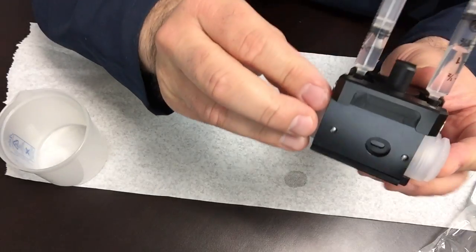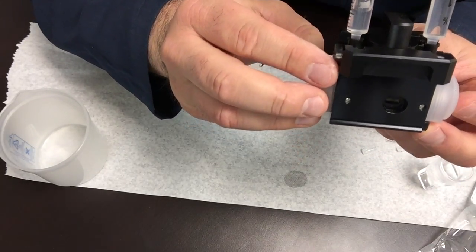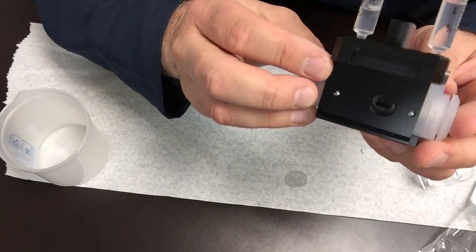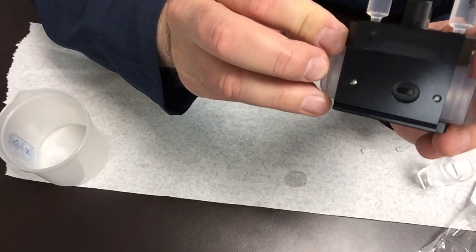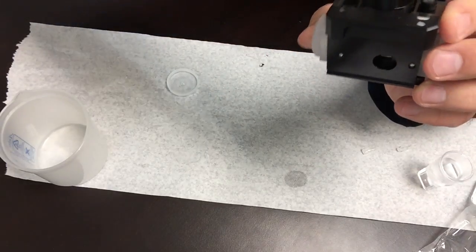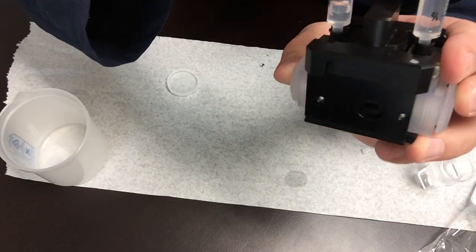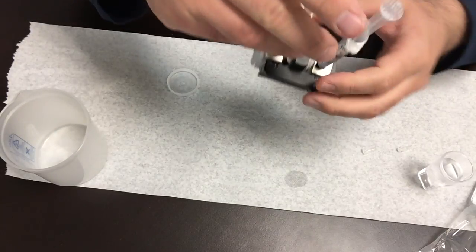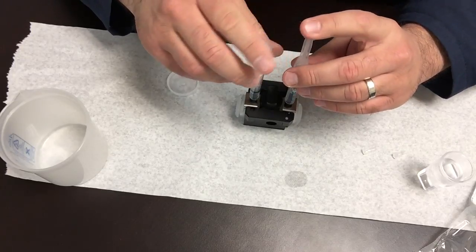And the way you look for the bubbles is if you look inside the opening at a 15 degree angle where the light path is, you should be able to see whether there's any air bubbles in there. As you push you'll see them racing across. Just go back and forth and once you see that there's no air bubbles moving across, very carefully remove one of the syringes.